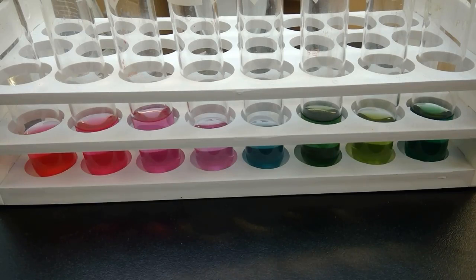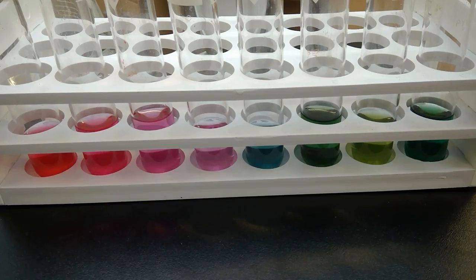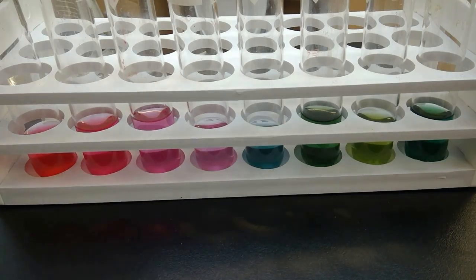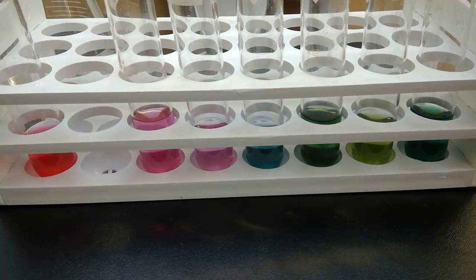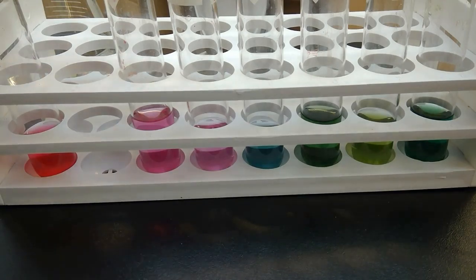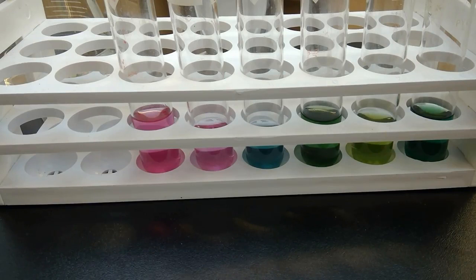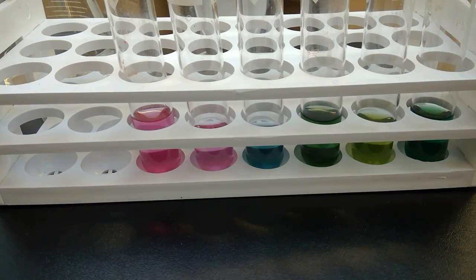This is a colorimetric test, so we're using colors to indicate numbers. It is a qualitative test and not a quantitative test. Qualitative because you're going to judge with your eye whatever result you get. If it's in between two colors, you're going to have to decide what the pH is. If it's closer to this, it's 3. If it's closer to this, it's 2. If it's somewhere in between, maybe it's 2.4.